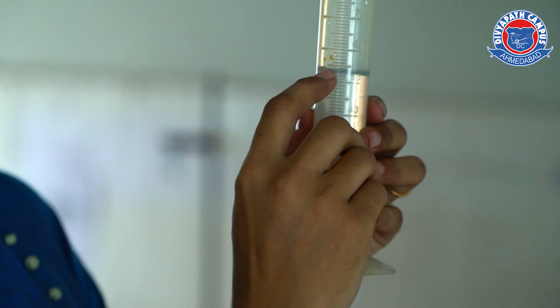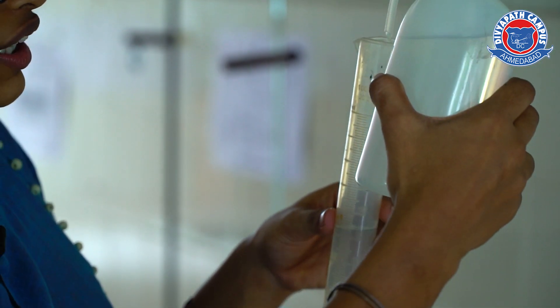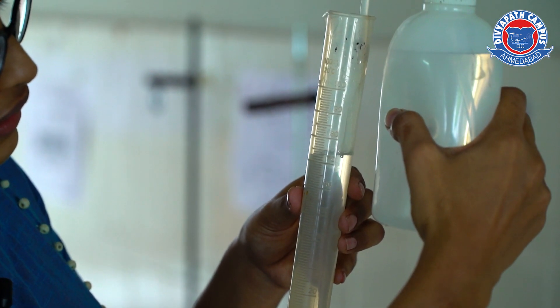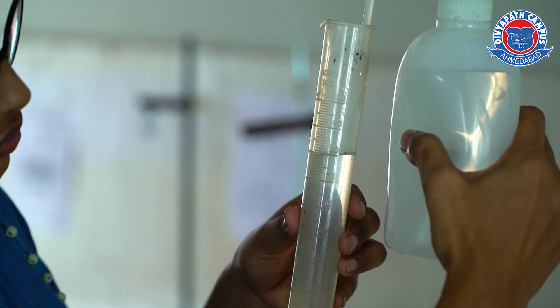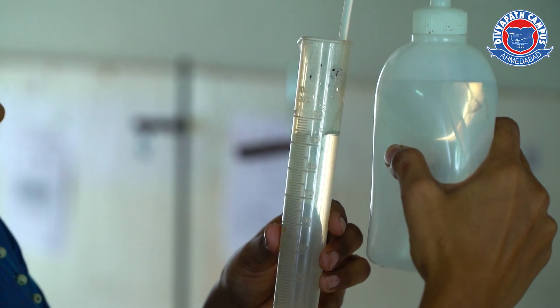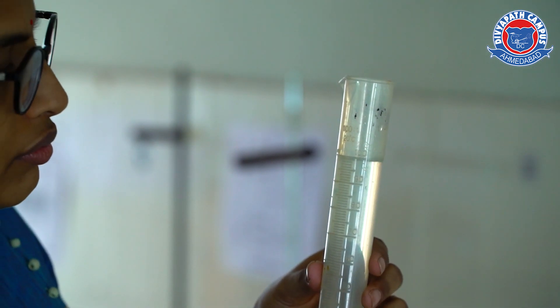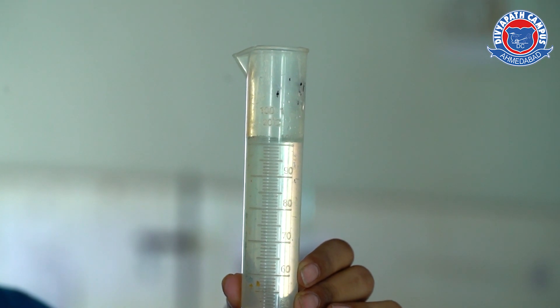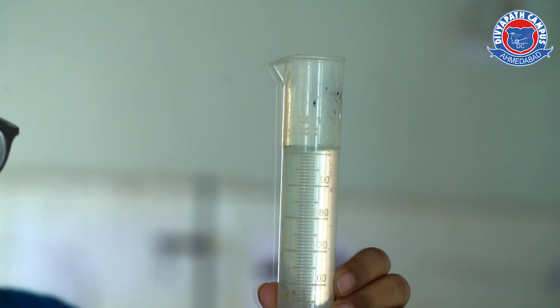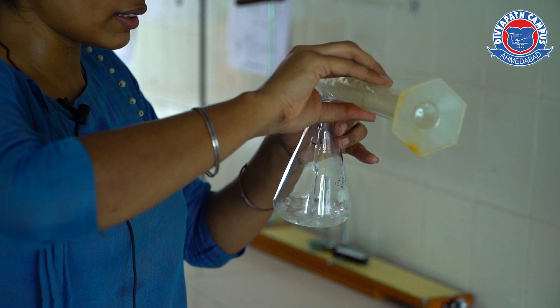Now the solution is near about 50 ml and we need 100 ml solution. So we will slowly transfer distilled water from the wash bottle to the measuring cylinder until we reach 100 ml. Now you can see it is 100 ml solution — we make it up. Now we will transfer the solution inside the conical flask.